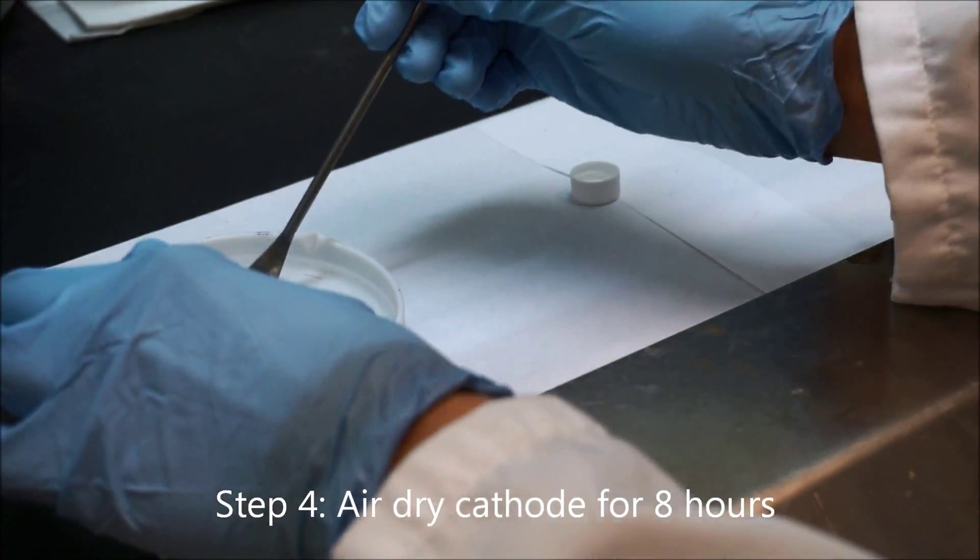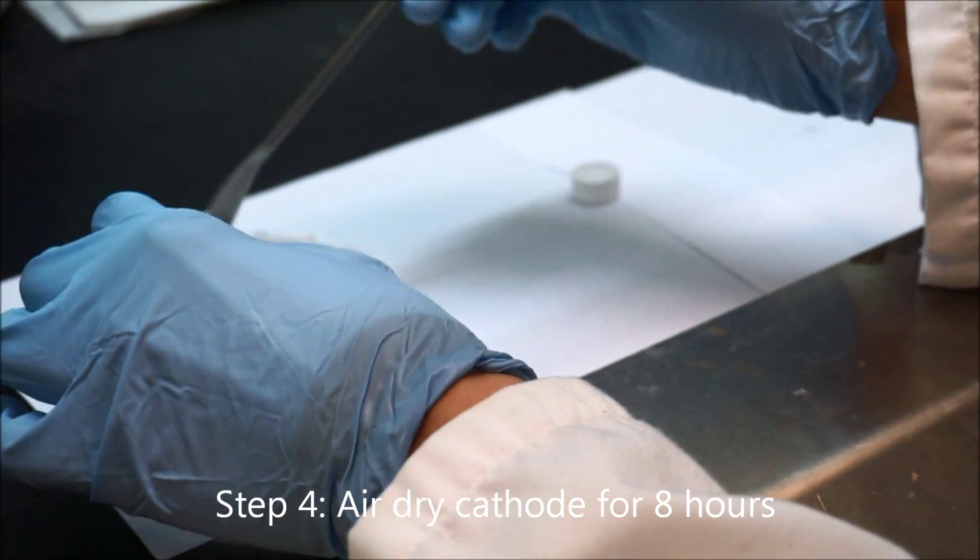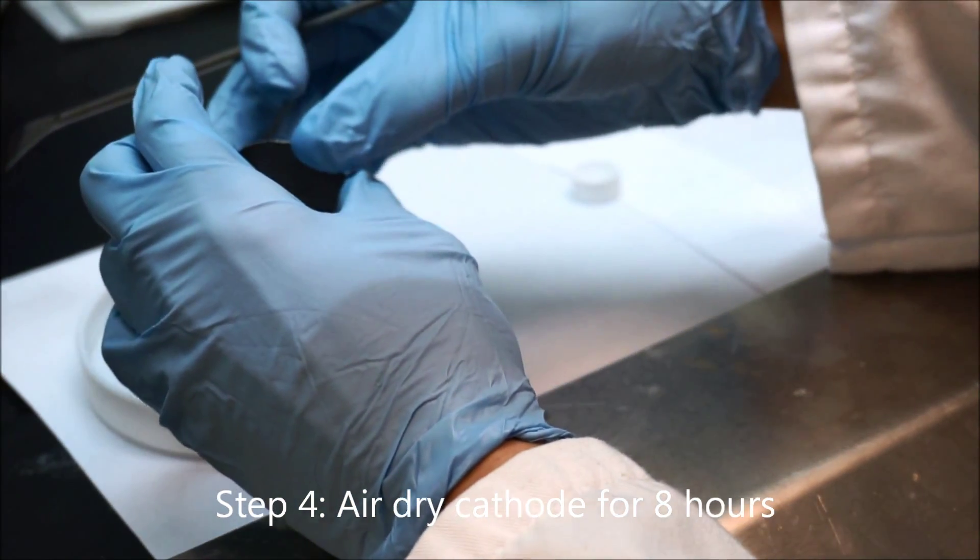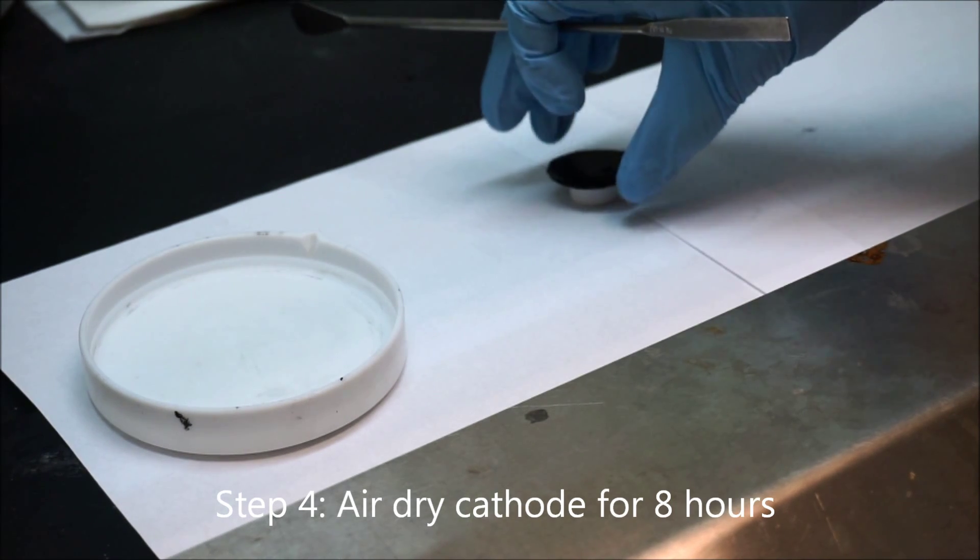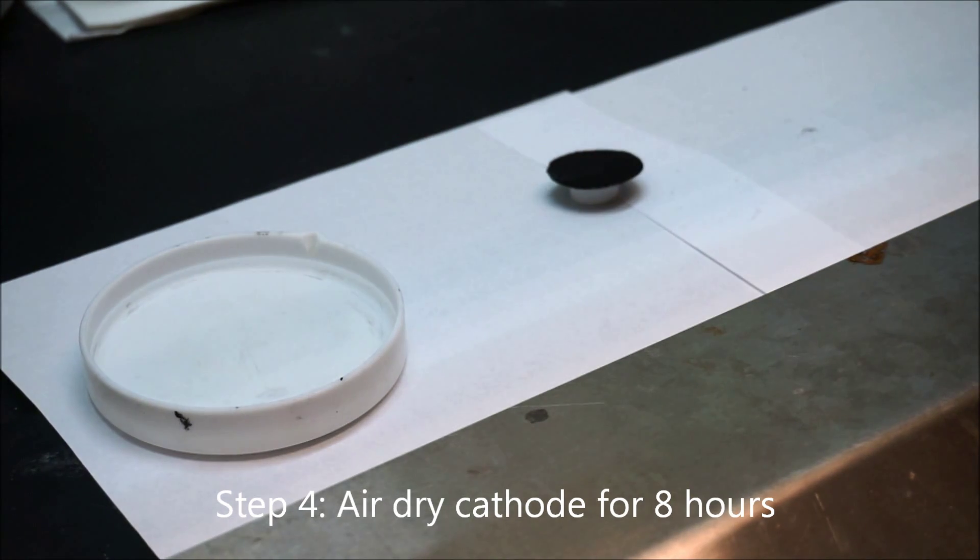Then we take out the cathodes and leave the cathode in the fume hood to air dry for over 8 hours.